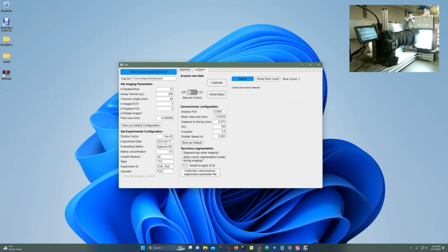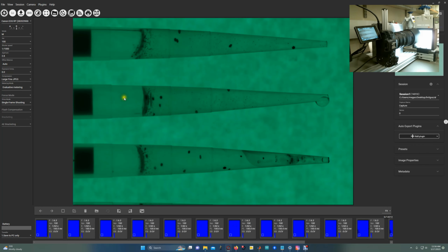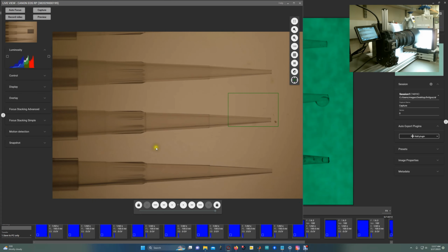And then in the acquisition tab, this is assuming that the camera has been connected, the Arduino is connected, and uploaded with the software, as was detailed in the written tutorial online on how to build the optical box. Once all those things have been done, you also have to install Digicam controller software, and it has to be running. So here we can see this button LV is live. That means that it's connected to the camera and is seeing the pipette tips that are currently in the field of view.